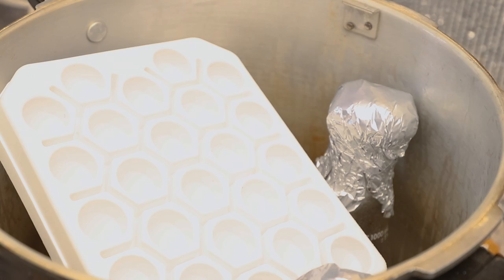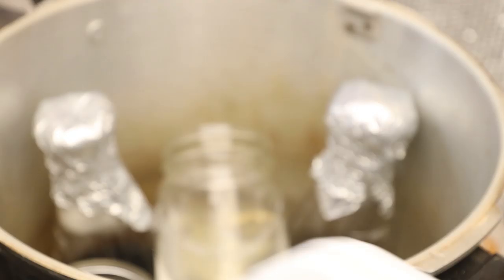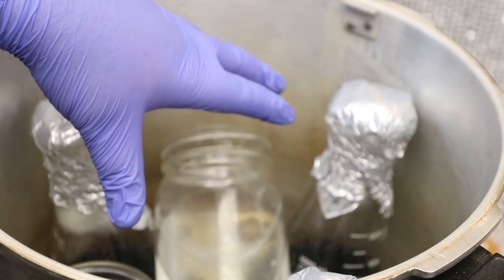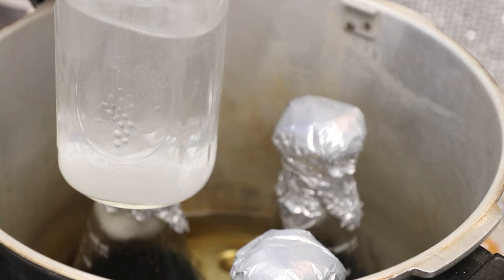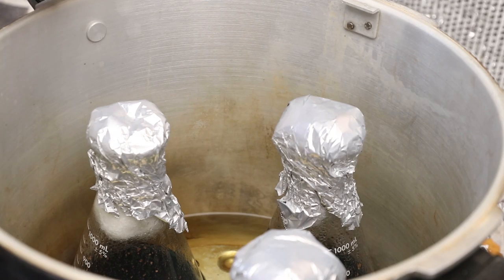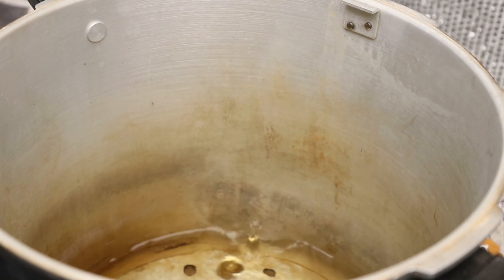So this is what I use to hold my centrifuge tubes for pouring agar and to store them until they're ready to go in the refrigerator. This glass right here was just put in to help weigh down and create a temperature buffer for my Erlenmeyer flasks. Everything in here is still piping hot. I try to put as much water in here as possible, and if your flasks start to float and fall over, it helps to put jars of water as standing columns to buffer the temperature, so the glassware won't crack when it cools in front of the fan.